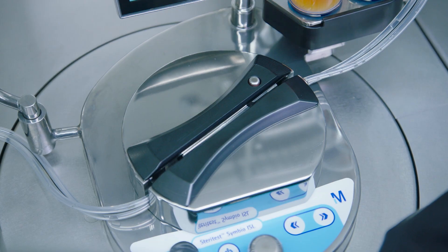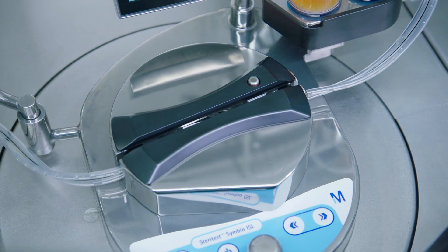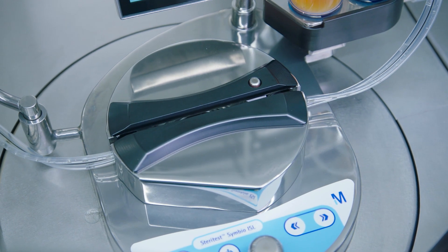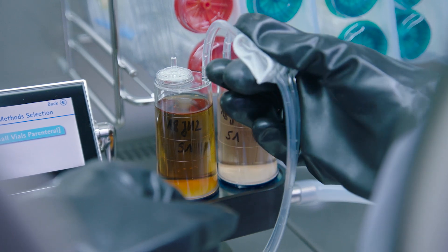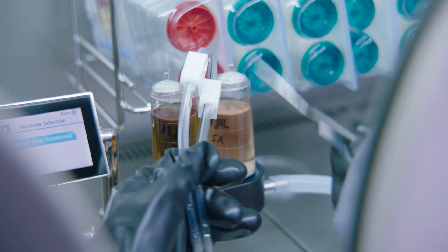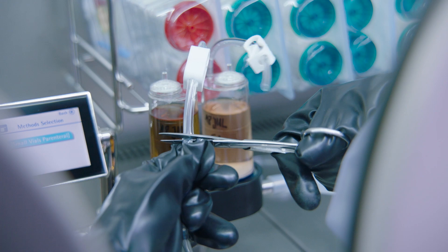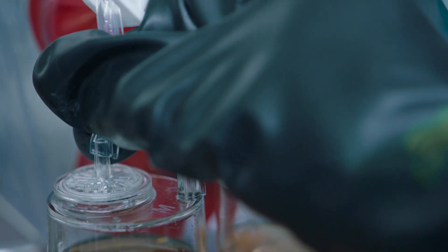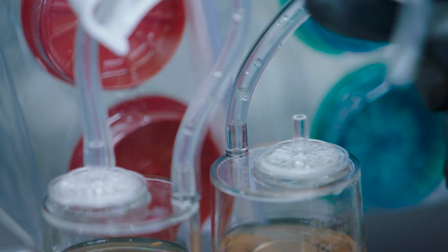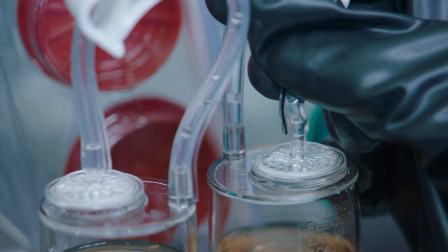The Steritest Symbio pump head and the needle clamps are opened before closing the canister. This avoids trapping residual pressure in the canister. After finishing the test, the Steritest canisters are checked for any abnormalities before they are unloaded from the isolator.